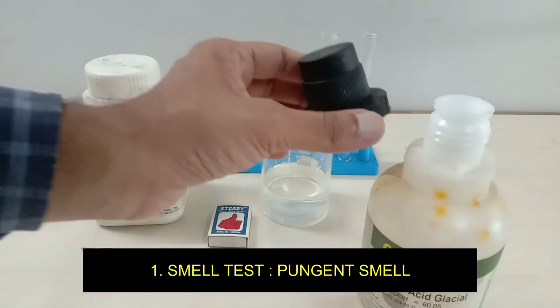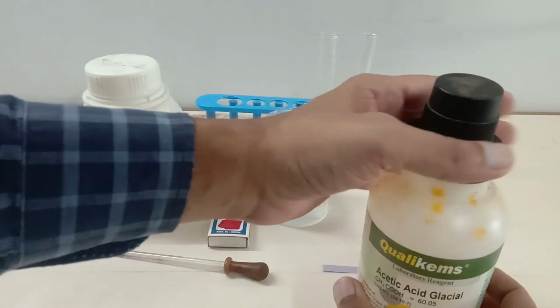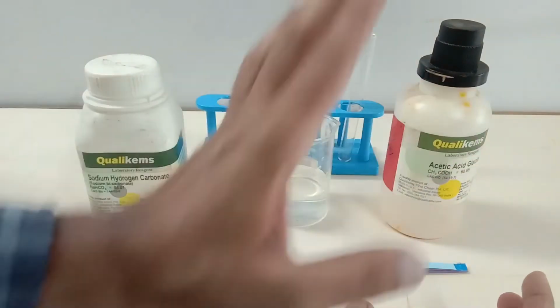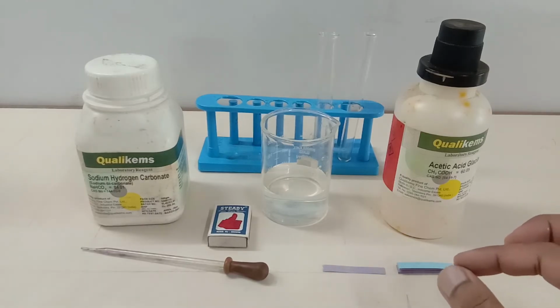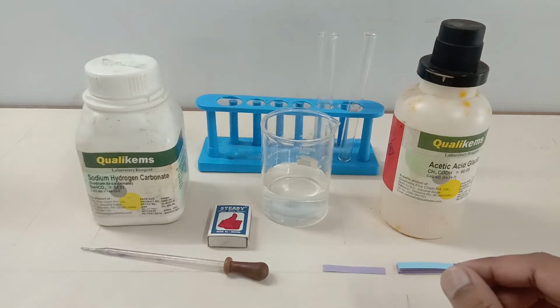Oh my god, that was very bad. Yes, of course, if you want to sniff this, you can go for the vinegar as well, and the smell is identical to that of vinegar. So the smell is the pungent smell, right? It's a very bad smell. You should not try it directly. Since 10% acetic acid is vinegar, you may go and try it in your kitchen.